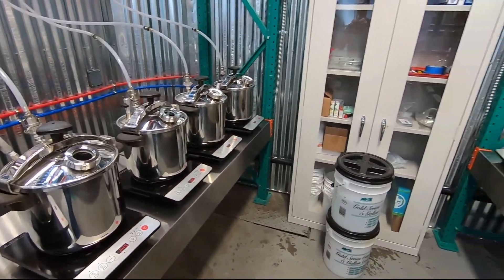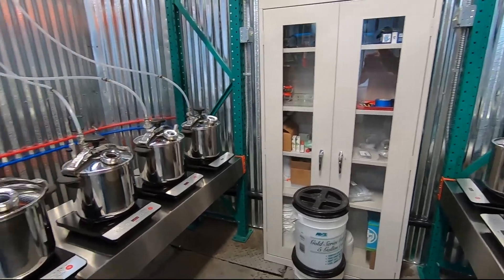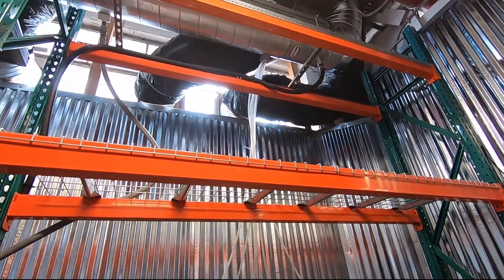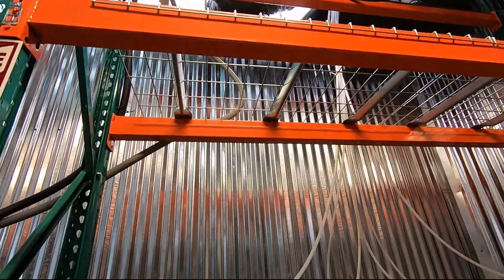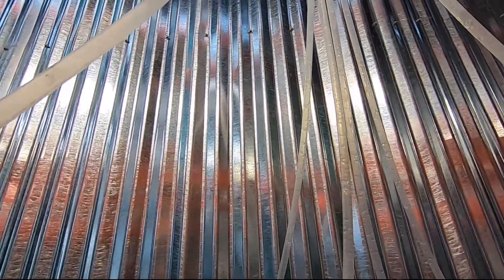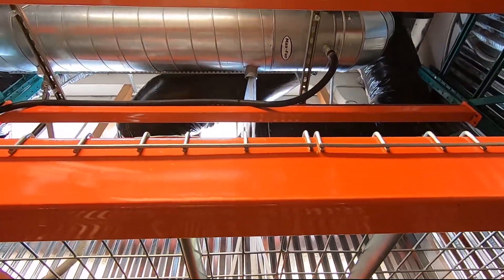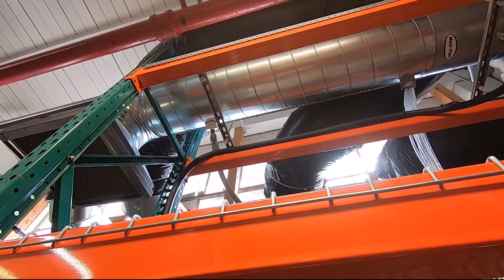This is my current setup. I'm again using the CRC filters 2.5 collection vessels here as evaporation vessels. I've got multiple setups — I'm running banks of six — and it works out really well. The key thing here is the air-cooled condenser. That's what replaced the water. I've got it running right now. Each vessel has a line running up to the condenser, and there are individual coils inside the shell that run into a collection manifold.